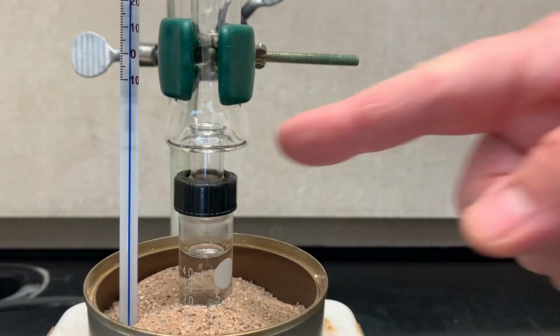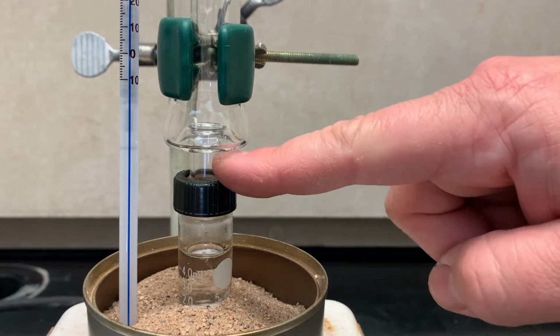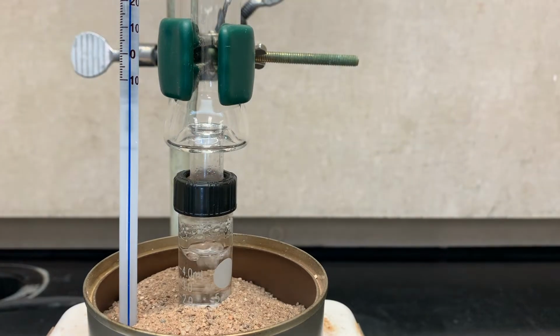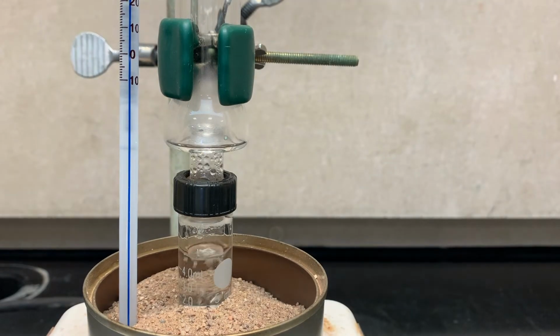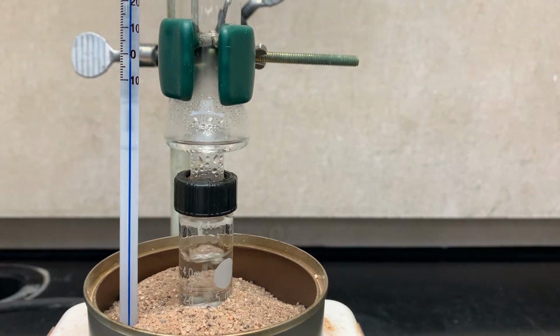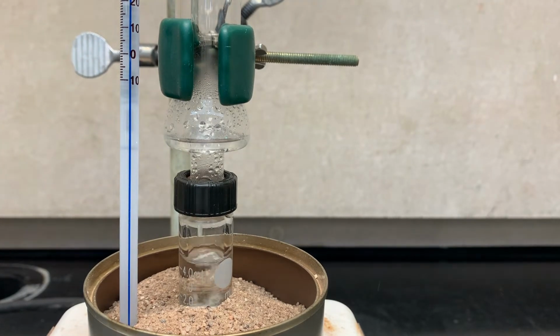Remember, one of the easiest ways to tell how far up our distillate has made it is literally by touching the glass and seeing where it's warm. This takes longer than you would think, at least half an hour, but be patient. It also helps to come down to this angle to see the distillate accumulating in the Hickman. Sometimes it's hard to see from the top.